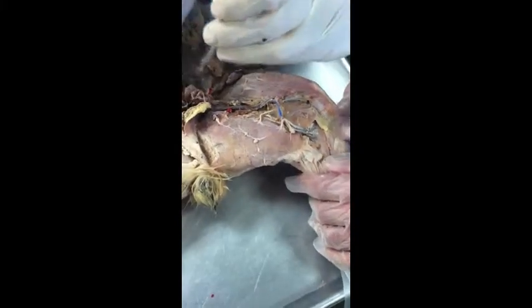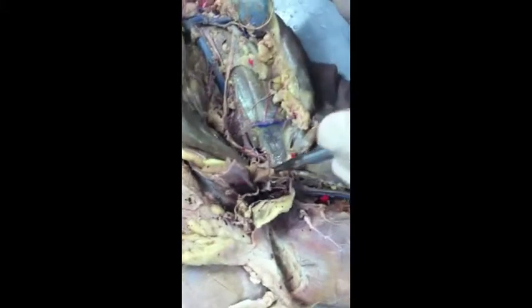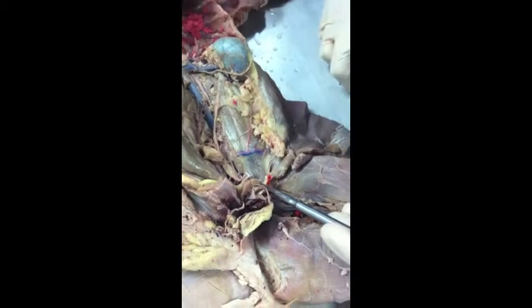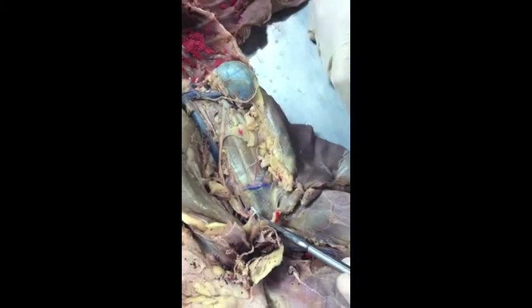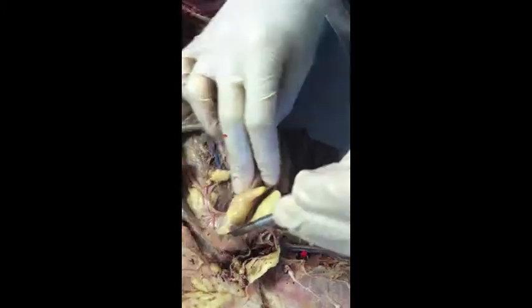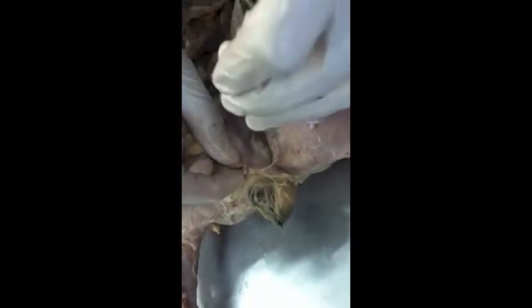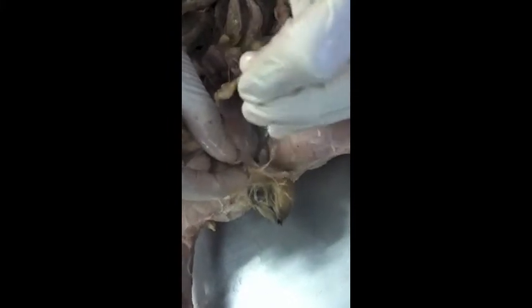How about these little guys? You have a male cat. What are these structures called? Spermatic cords. Spermatic cords will lead into this. You have it here, and you have them. Vas deferens. Exactly. These little guys here on the side. So if that's vas deferens, your cord should be up under here, and that would be the spermatic cord. Okay, there's spermatic cord.